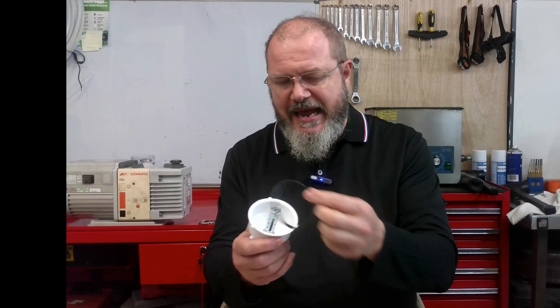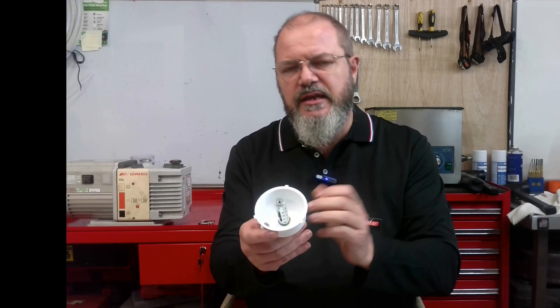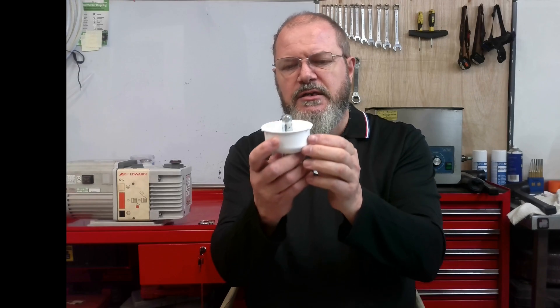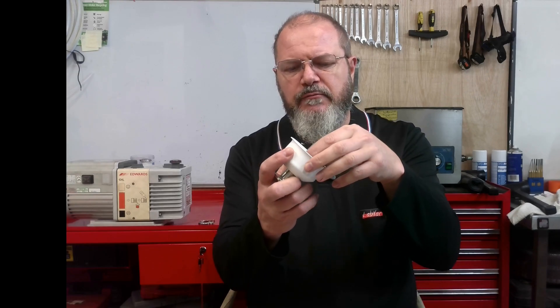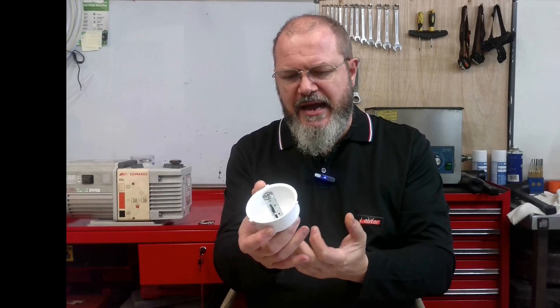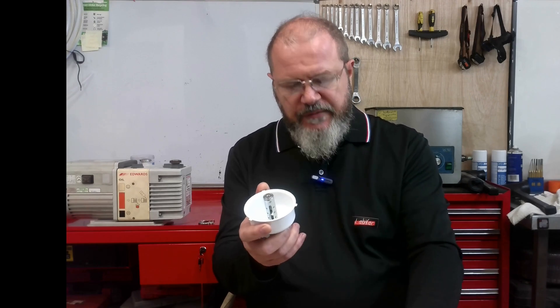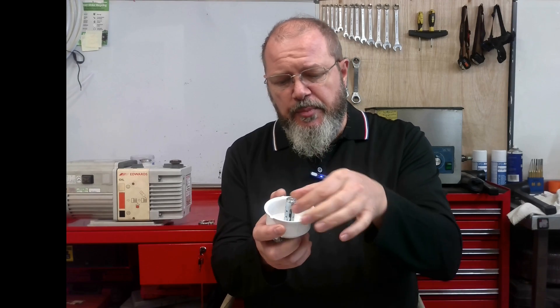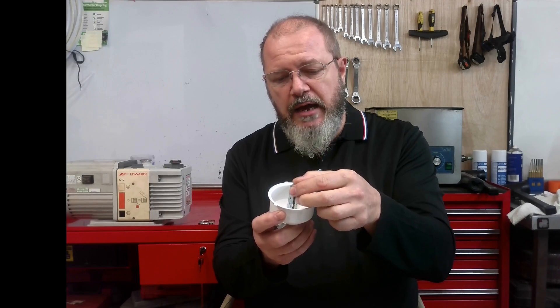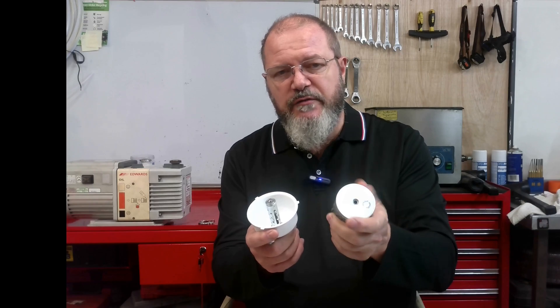Inside the can, there's an O-ring to seal the two halves. And you can see this centre stem — this is where the outrushing air from the pump will travel through. There is a spring-loaded relief valve in the centre. It's too stiff to lift by hand, but when you have very high pressure coming out from the pump — should the filter become blocked — the spring pressure relief allows pressure to release through here without going through the filter body itself.